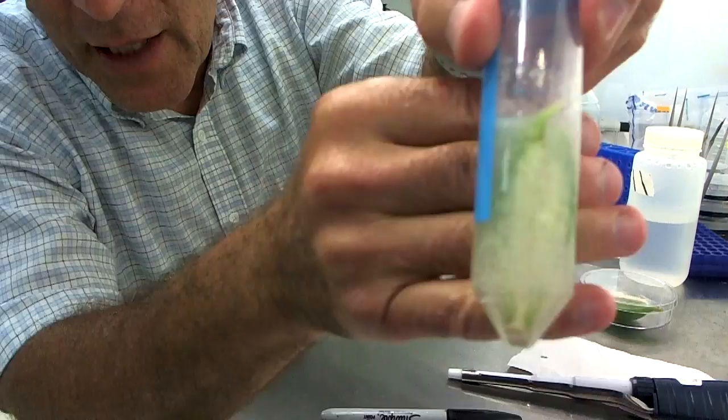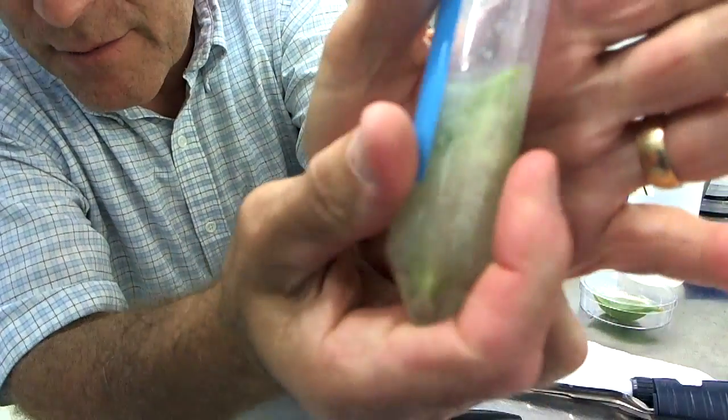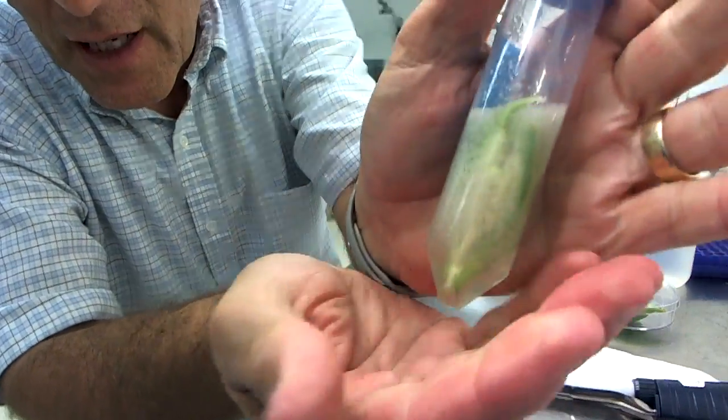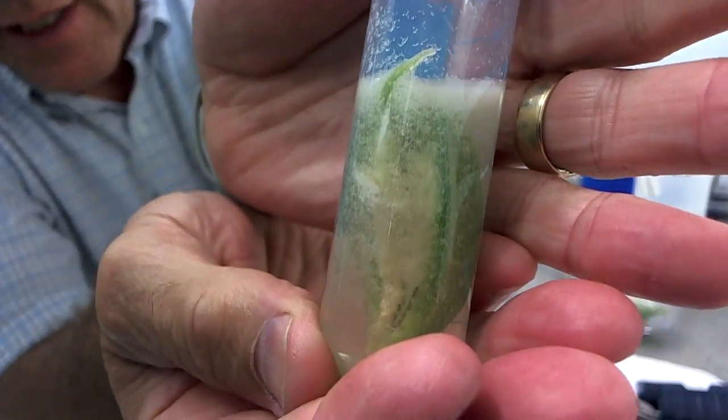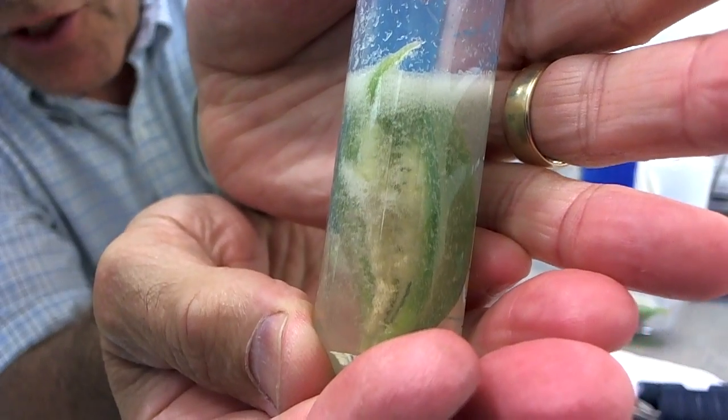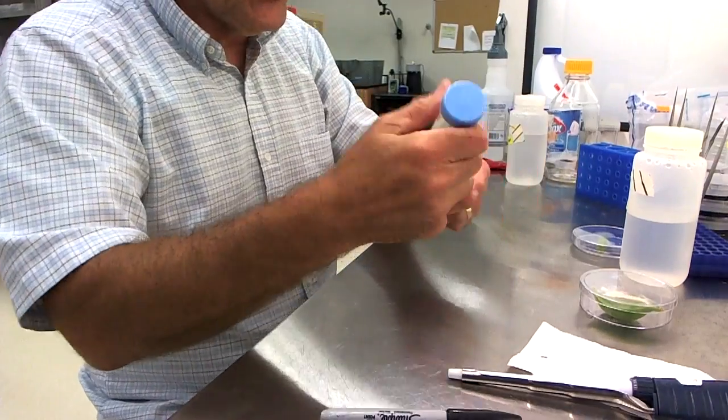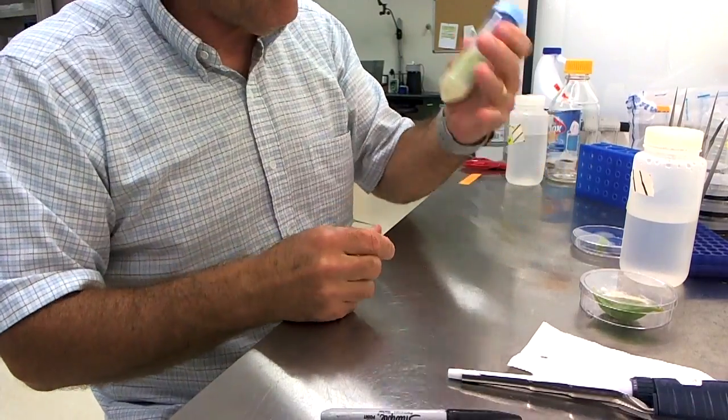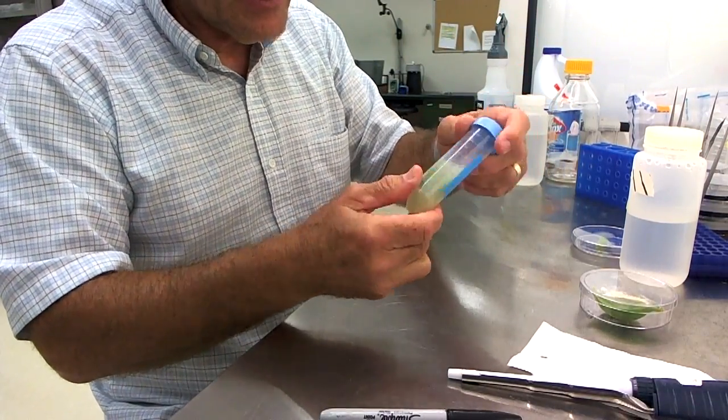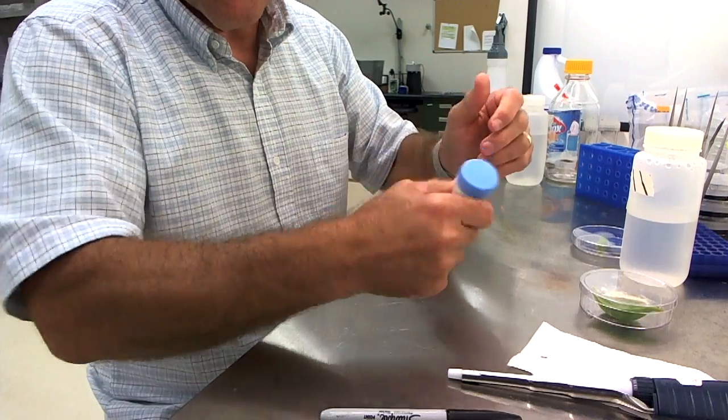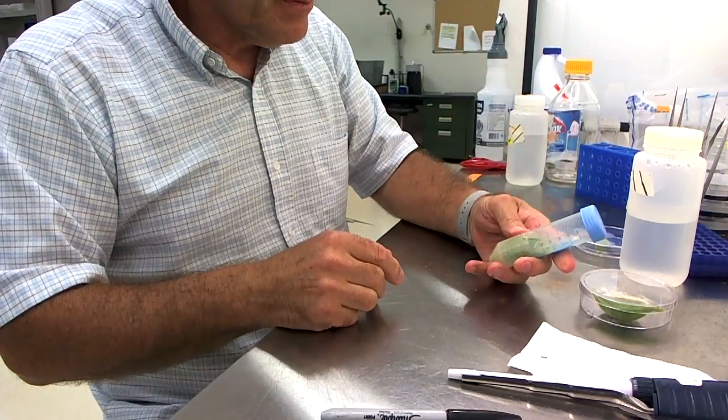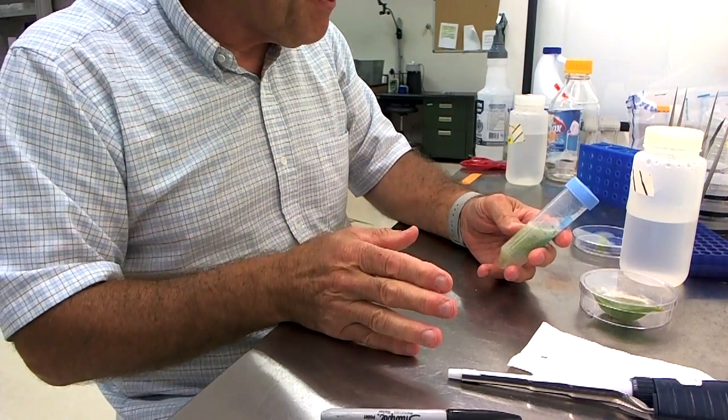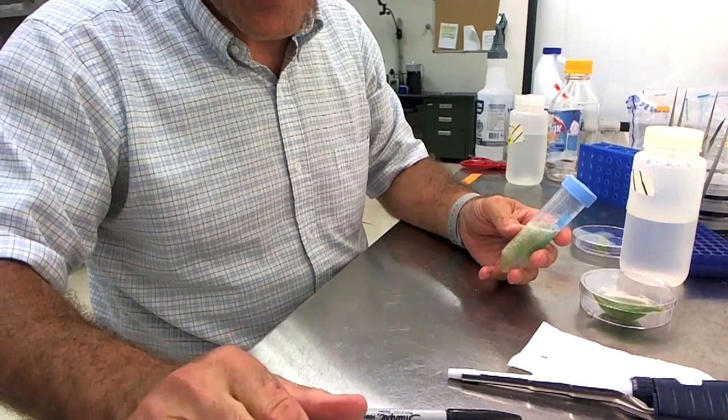What I'm doing is making a suspension of seeds in this. You can see that there's a suspension of seeds here, and what I'll do is, after I shake a lot of them out, I will plate them out on the medium, and there should be plenty. I'll show you that too. Let me take a little bit of a break, and then we're going to take a look at the other seed capsule.